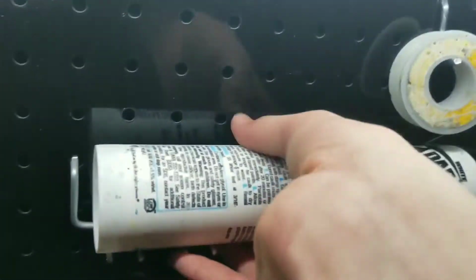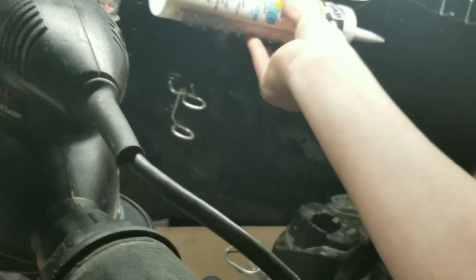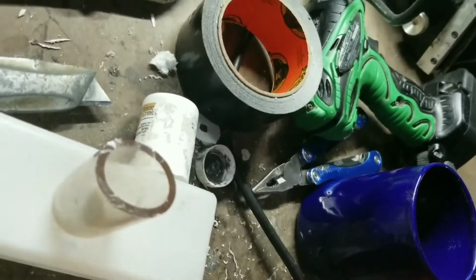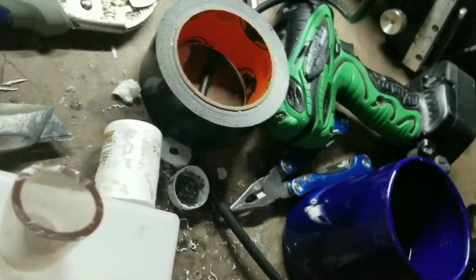Now you see, we're not only going to want a glue that's strong, such as JB Weld. We're also going to want a glue that is chemically resistant, and that's why I'm using Flex Seal. Flex Seal is silicone, and you could just use normal silicone if you had that. I don't have the silicone gun, at least I don't know where my dad put it, and I've got this Flex Seal that I want to use up since I lost the top, and it's drying out. So that's why I'm using it.